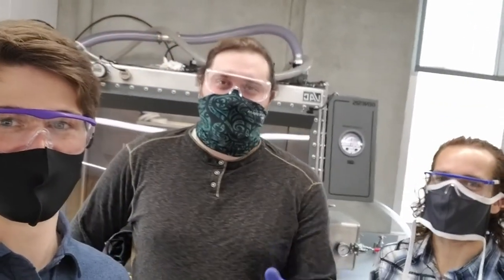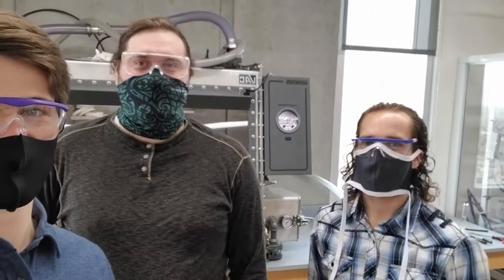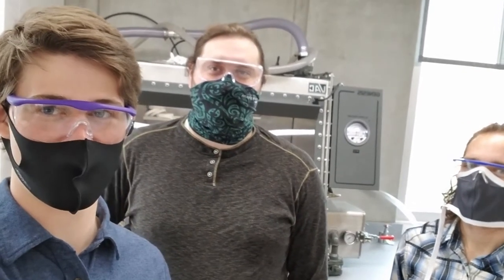I'm Isaac Preston. I'm Nicholas Smith. I'm Dawn Latham. And we are just going to show you how to work the glove box that's behind us.